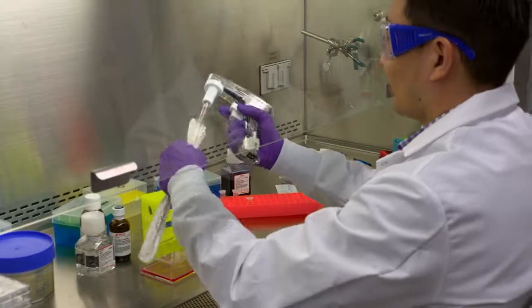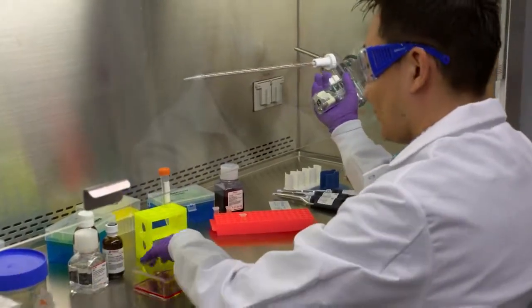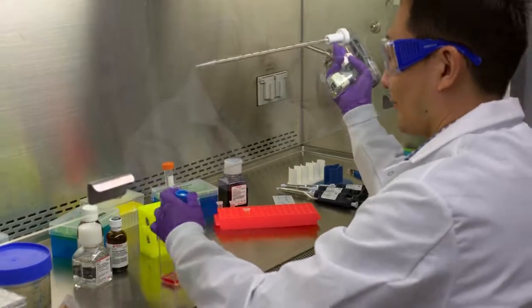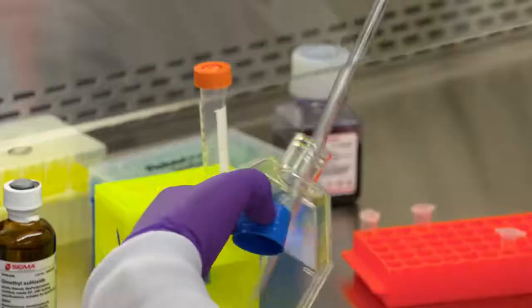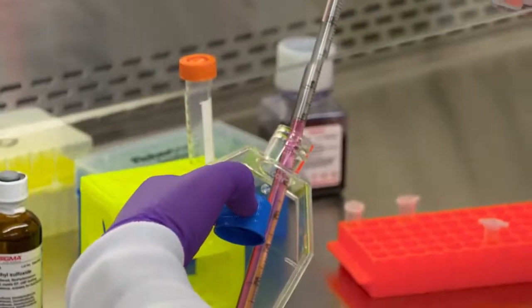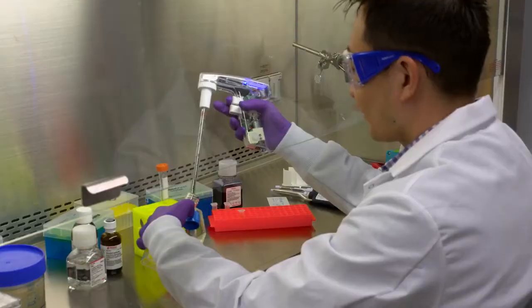Cell counting is critical to various workflow steps during tissue culturing and it is often coupled with viability measures by using Trypan Blue. While there are a number of different cell counting technologies out there, we'll focus on the most commonly used counting method which is the use of hemocytometer.